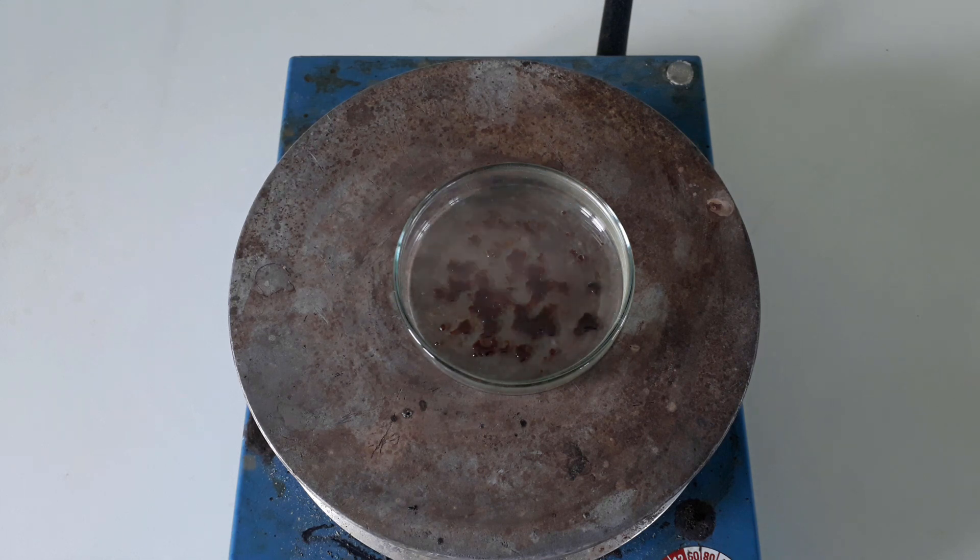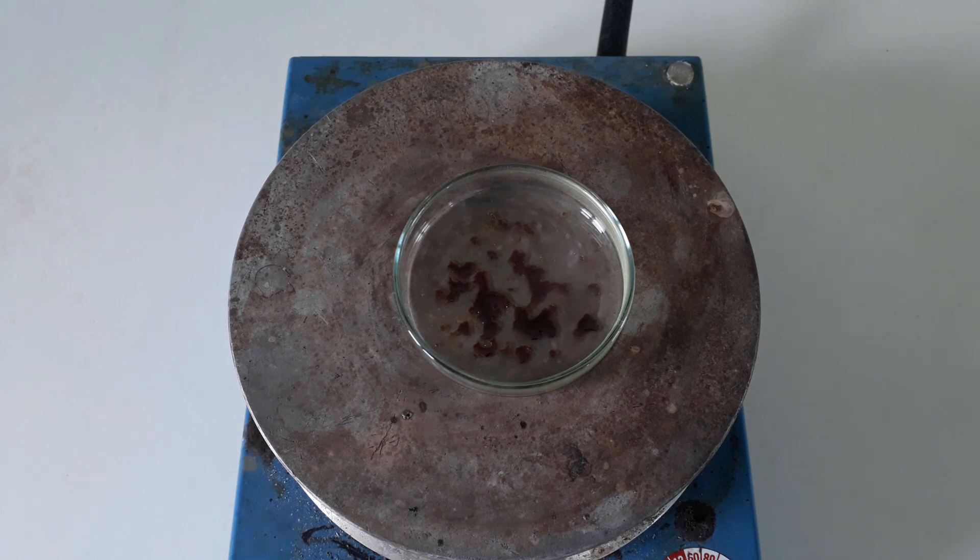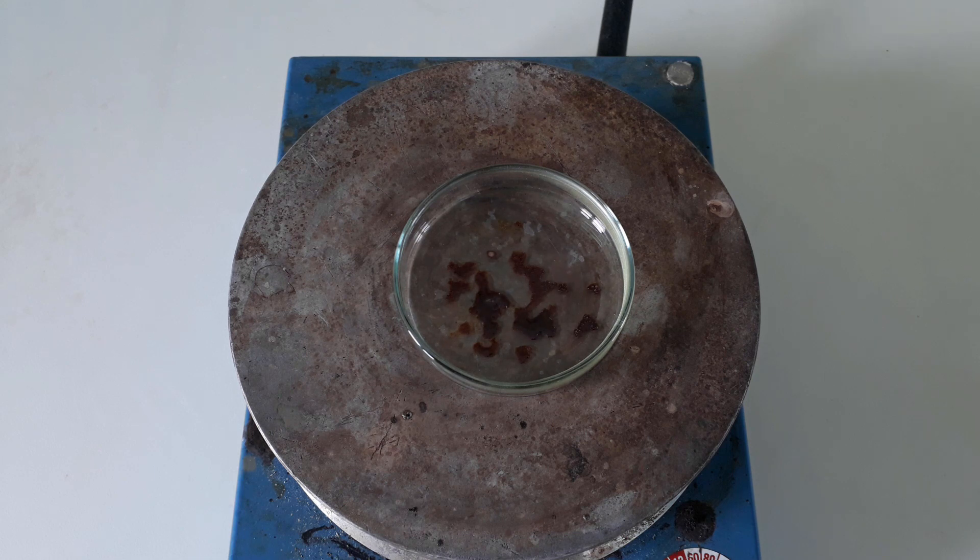The thing worth mentioning is the intense smell of this compound and the enormous amount of fumes this compound gives off while it's liquid. But even in its solid state, it has a high enough vapor pressure to stink up a whole room, even in small quantities.